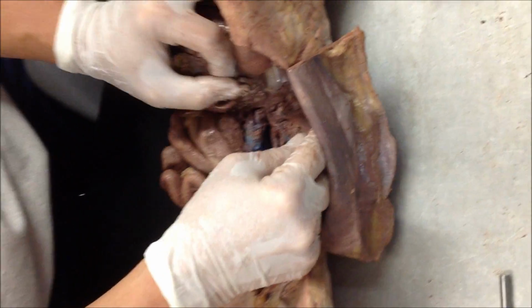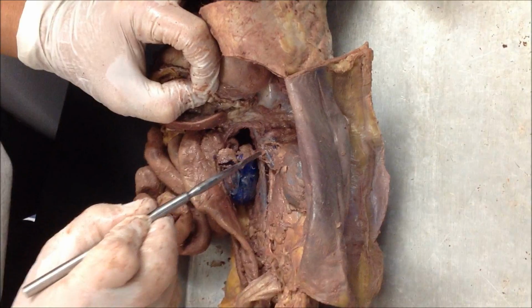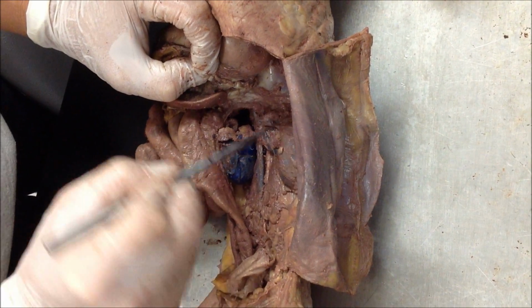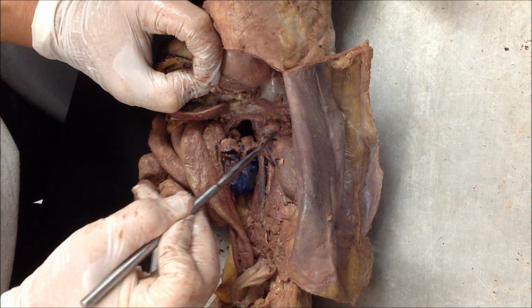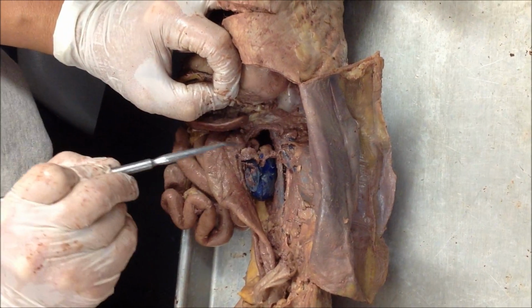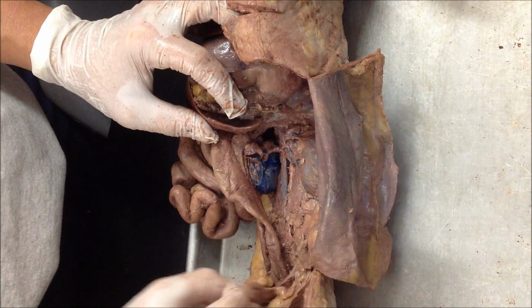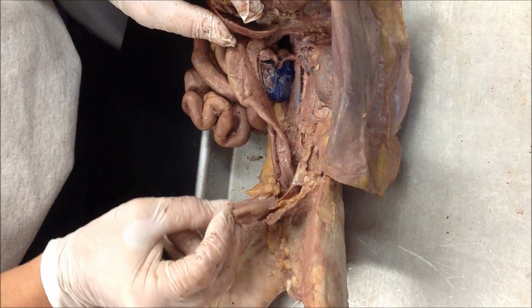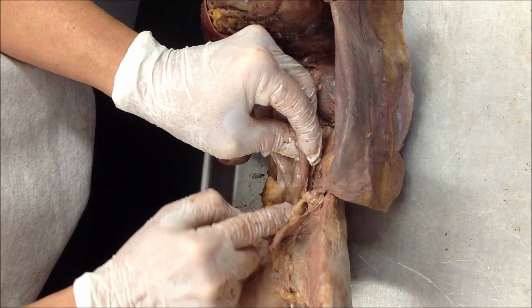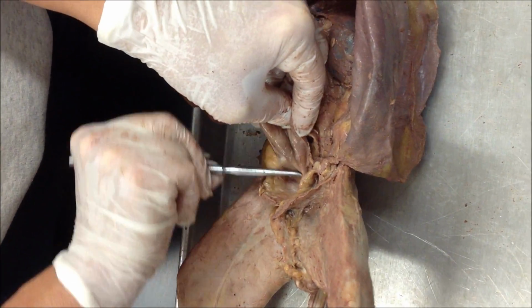When you look up here, if you look for the renal vein, right, and then right above that, this little structure right here that looks like a little bitty kidney bean, that's going to be the adrenal gland. Where is it on a human? On top. Top of the kidneys. Excellent. This is going to be urinary bladder, so if you can pull this all the way out, this one tube right here, that's the urethra, right? Because it goes out.